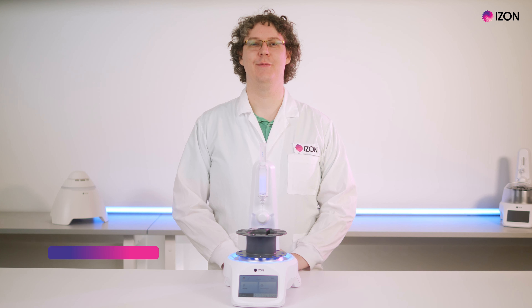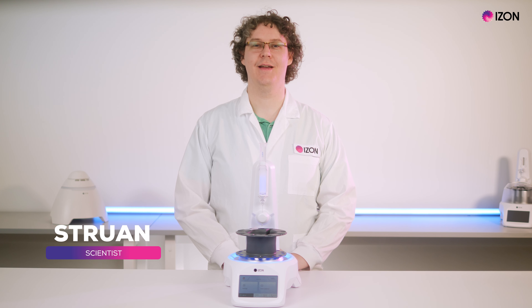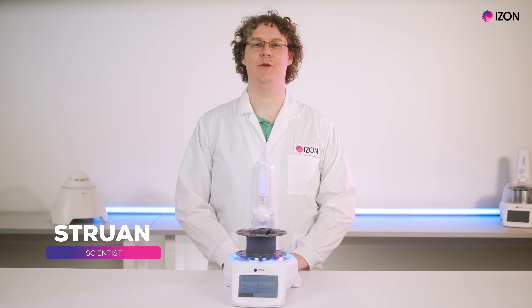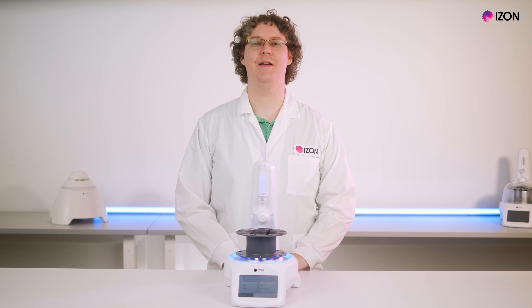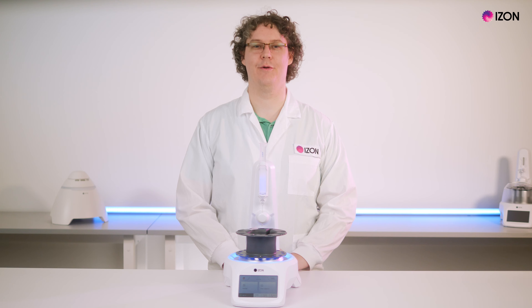Hello everyone, my name is Struan and I'm a scientist at Izon Science. Today I'll be showing you a new functionality of the AFC which makes EV isolation even easier and more efficient. But first, a bit of background information in case you're new here.